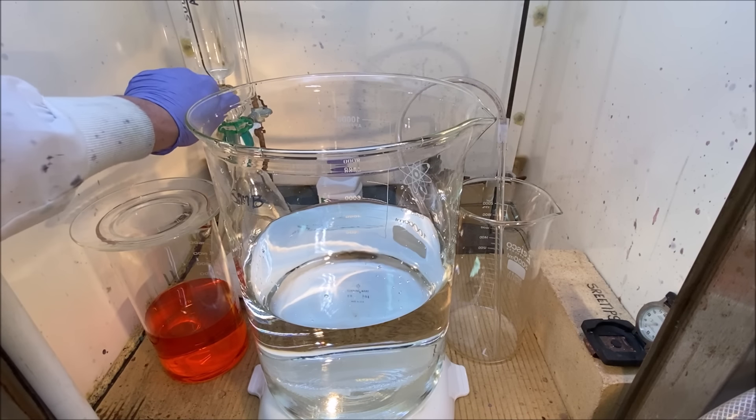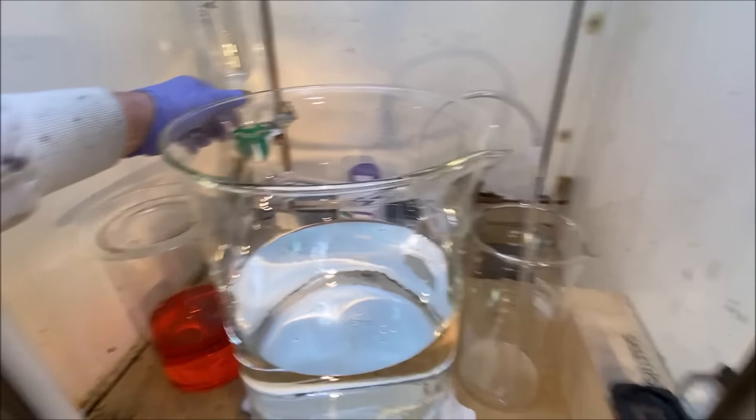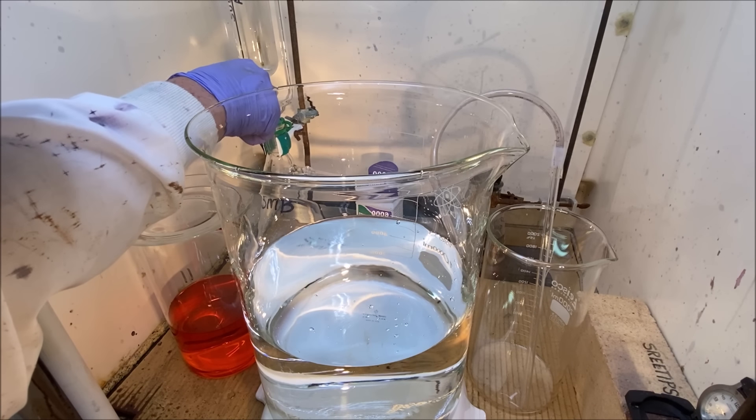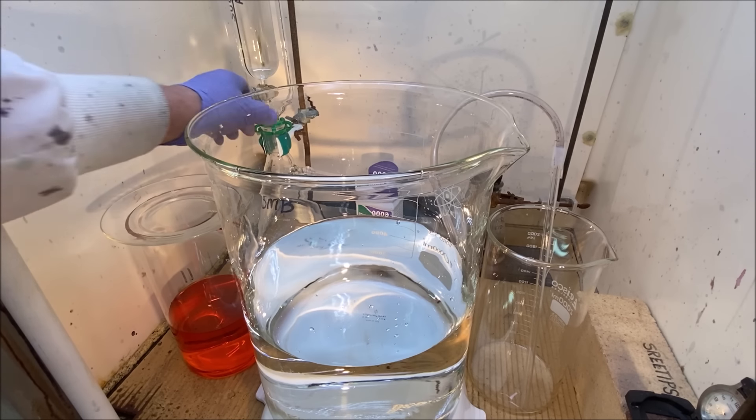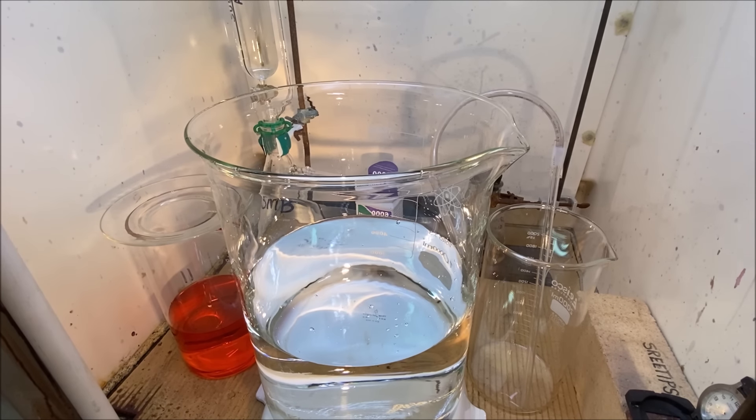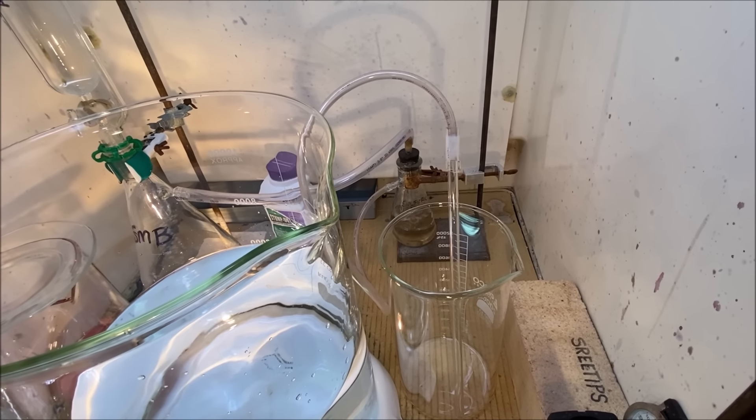I'm going to reach back in here and start a little bit of acid dripping into the gas generator and get some gas flow established.